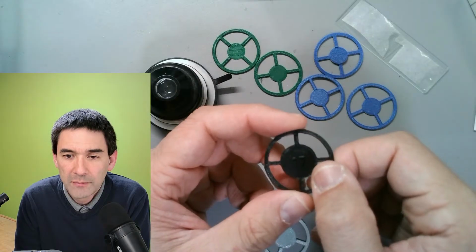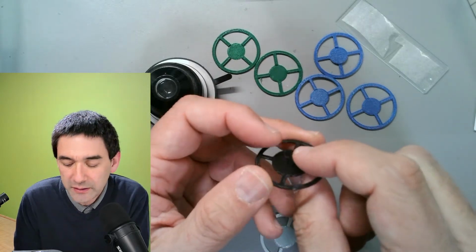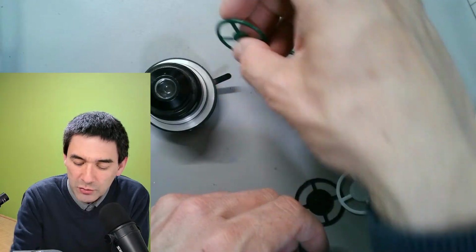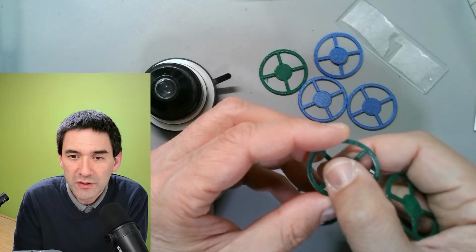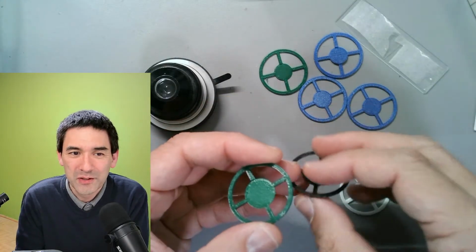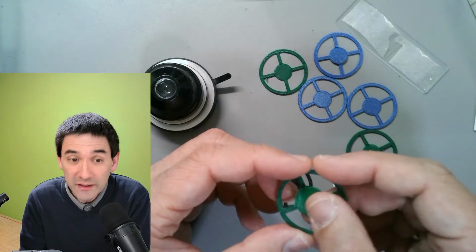The thickness is 0.2 millimeters. Generally, if you want to block out the light completely, you can make it a little bit thicker. But what I've done here is, if you want to give it a background color, then it should be fairly thin. So I've got 0.2 millimeters. Yeah, the print labeled one here. Exactly. I've made a whole series of those and thrown them away if they didn't work. So that's why it's trial and error, really.